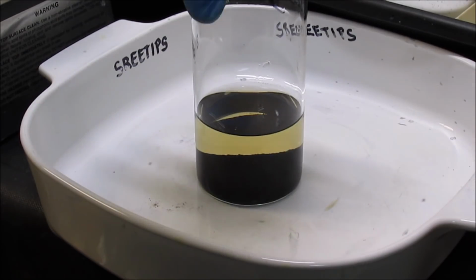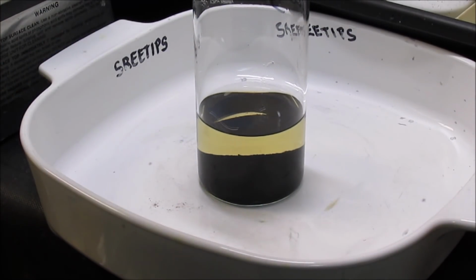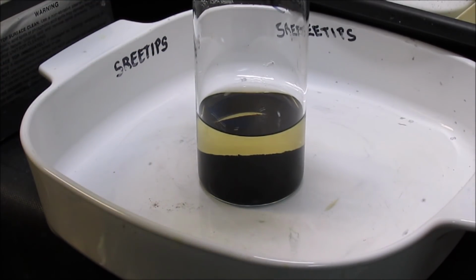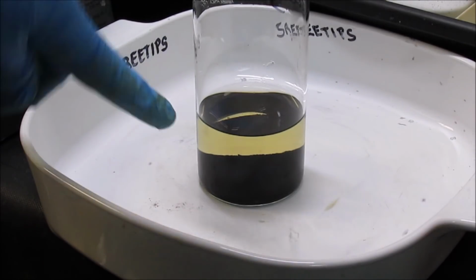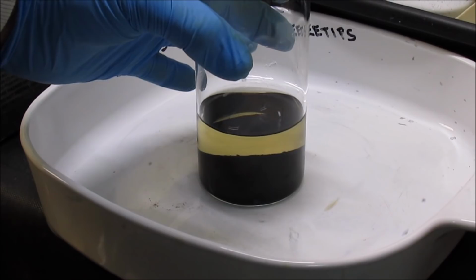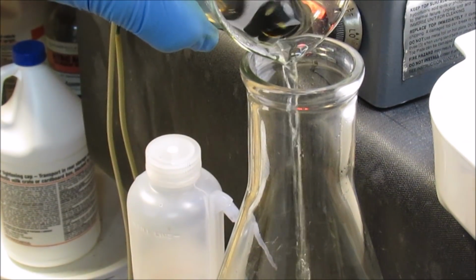Alright, if you look at this beaker here, it's got a brown liquid in it. If you remember earlier in my series, I tried to use some sulfuric acid to get the copper out of there. I was looking for a green or a blue color, but I think that brown color right there is the copper. So I just wanted to show you how quickly this stuff settles now.